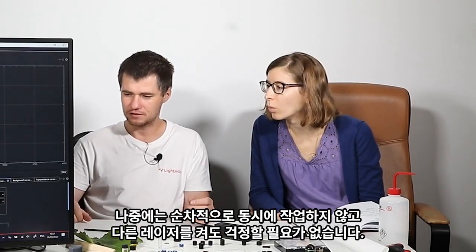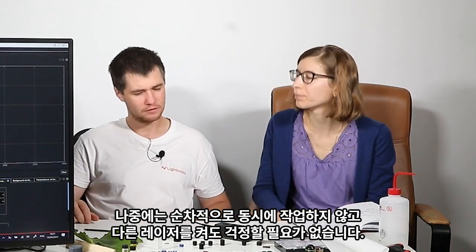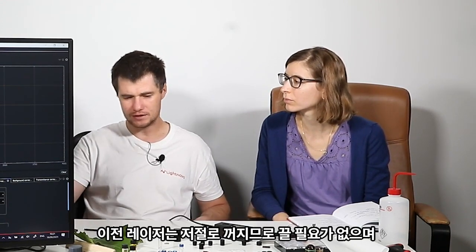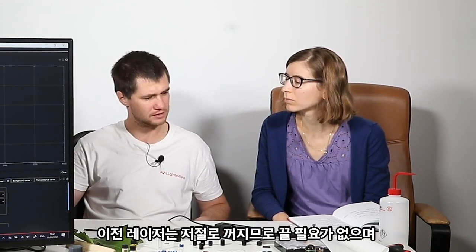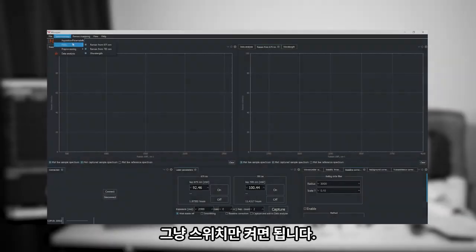You have a question? No? Yeah, maybe later. Are they working at the same time? No, they work one after the other. Sequentially. And by the way, you should not worry. You can turn on another laser. The previous will turn off by itself. Okay. So you don't need to turn it off, and you can just switch.